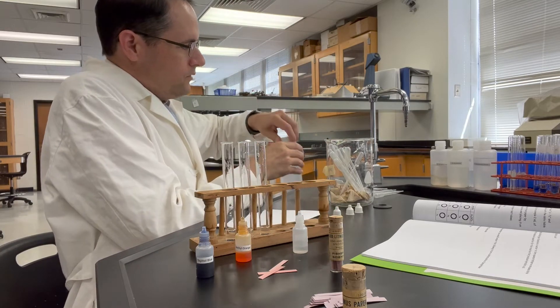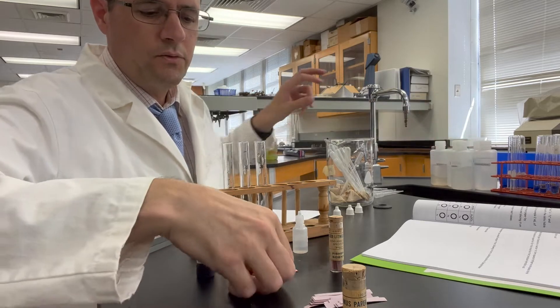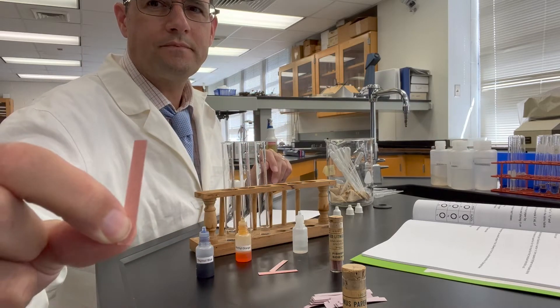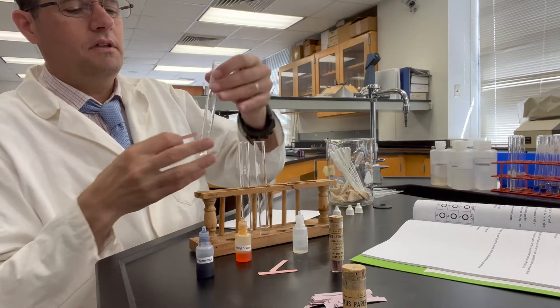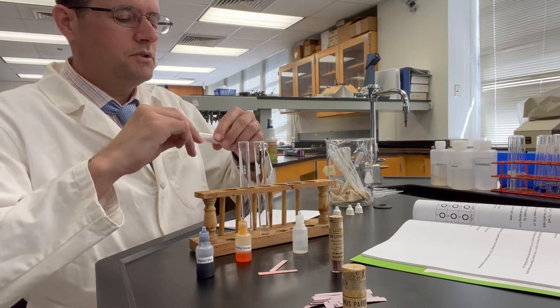We will test with litmus paper first. We've got red litmus paper here. We'll dip the tip of this into the solution.